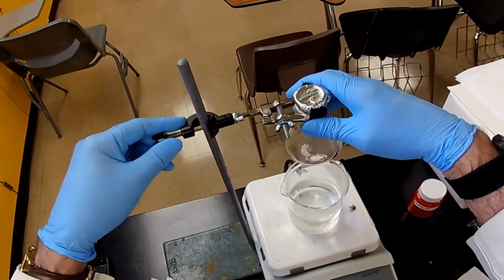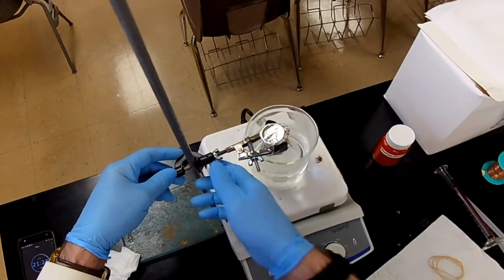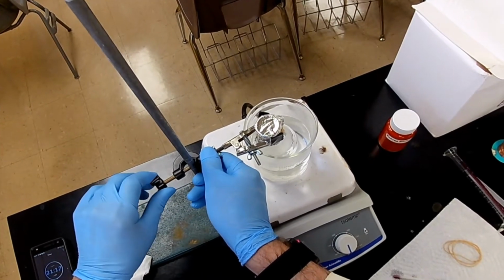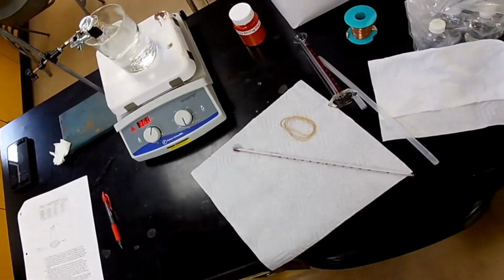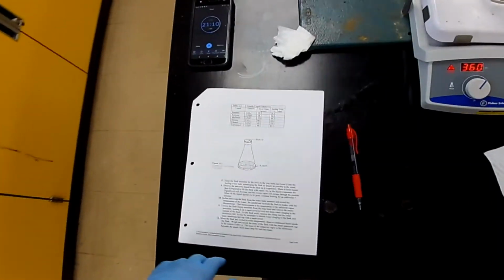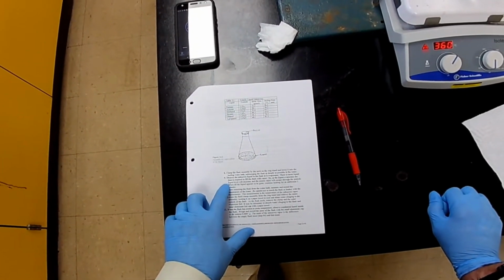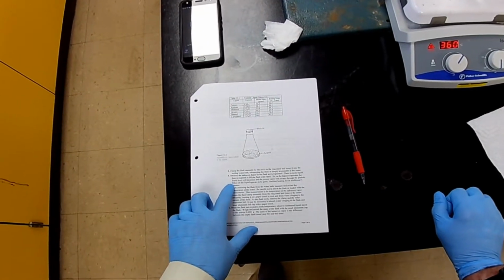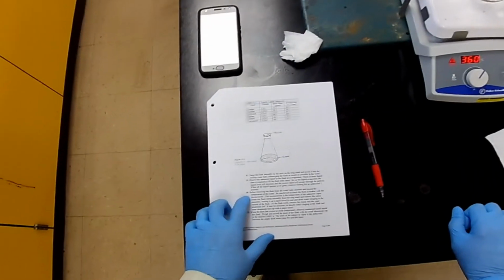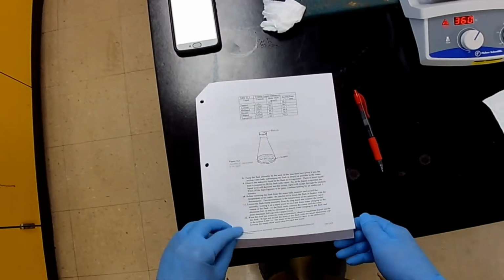Okay, now let's submerge this thing in water like this. That's as deep as we can get it. It's not ideal, but it'll have to do. Now, how long do we wait? It says, let's see. It's just telling us to look, see if the liquid's gone. I think we need to go about 5 minutes or more.